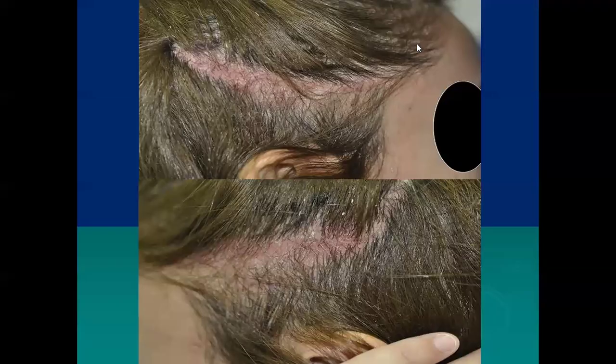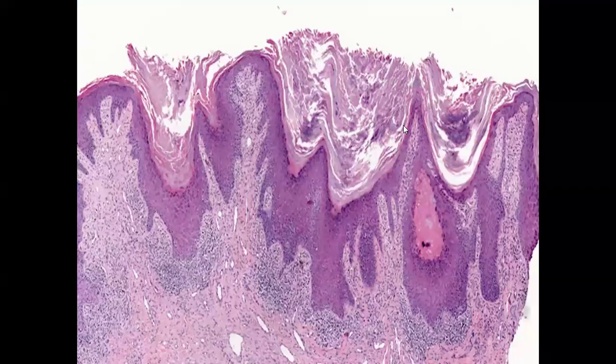And there is an alternative condition which is again characterized by hair loss, but now these lesions are not large and thick like DLE. This is a condition called lichen planopilaris. This is a follicular keratotic condition in which you can see thickened or plugged hair follicles. Along with this, there will be basal cell degeneration, pigmentary incontinence, and a band-like lymphohistiocytic infiltrate that will be surrounding the hair follicles and not the intervening skin.